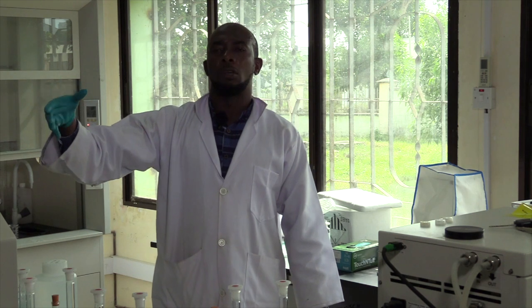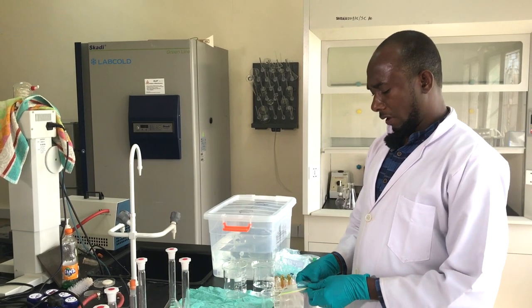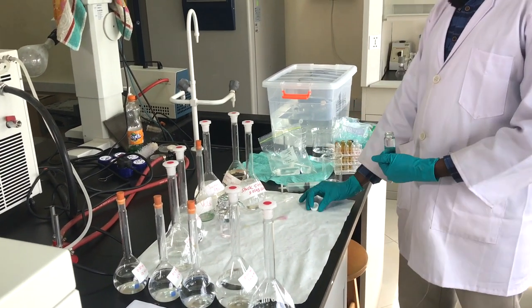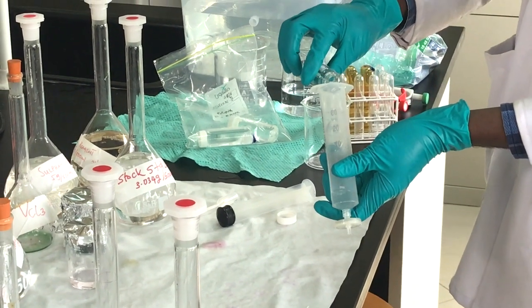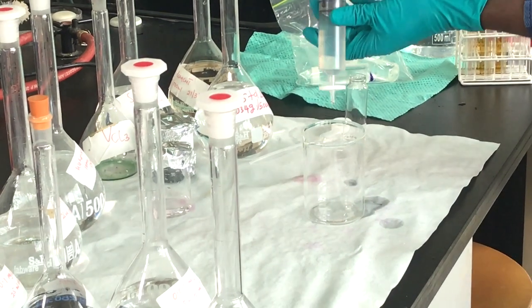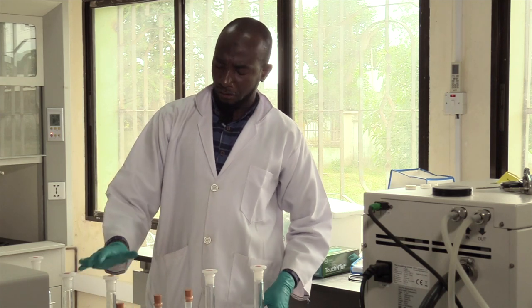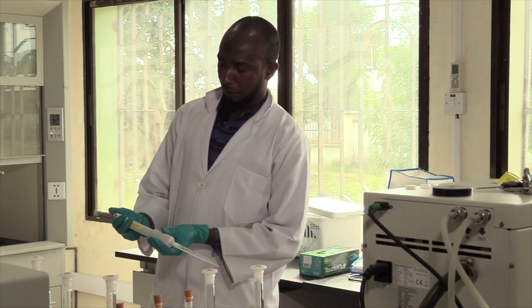Those readings will be used to obtain the calibration curve, and that calibration curve will be used to calculate the nitrate concentrations in our samples. We have samples taken from Mbawe at five different depths that we want to analyze. We take them one after the other, opening each and pouring the contents into a beaker.